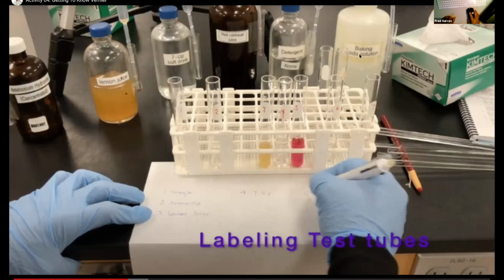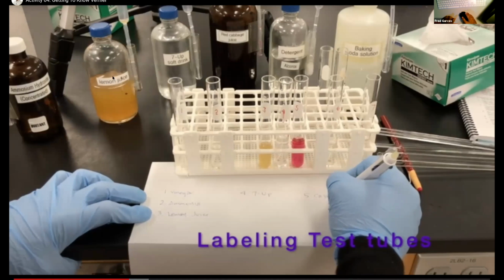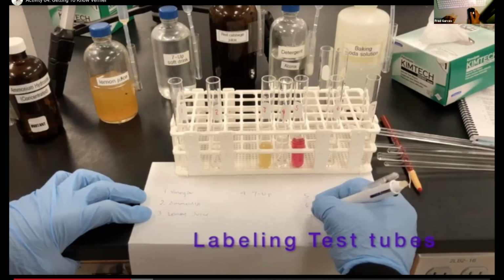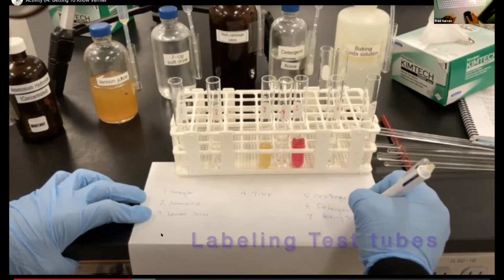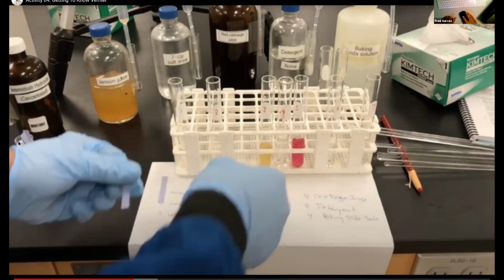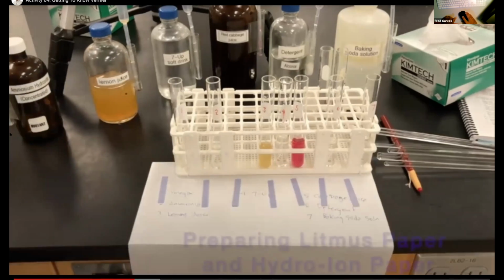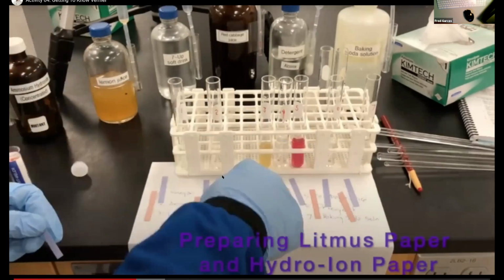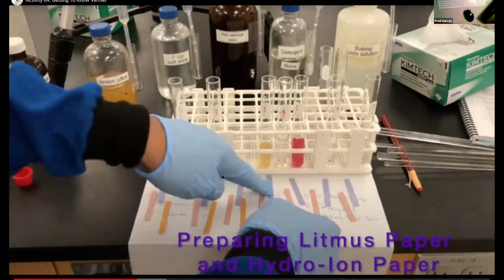There's a missing bottle in here somewhere. Yeah, vinegar is to the left that you don't see right here. Vinegar is all the way to the left. That's why it's not shown in this picture. But this is how you would set up this experiment if you were doing it.